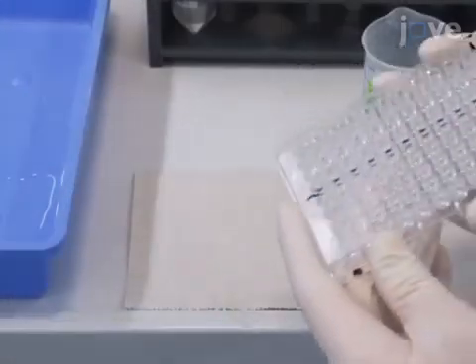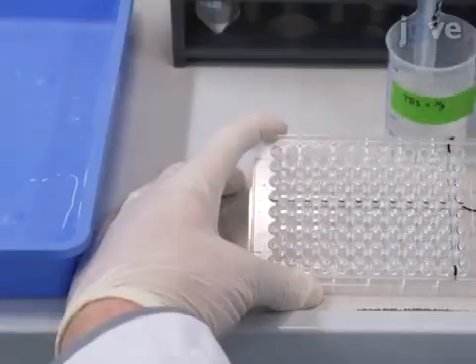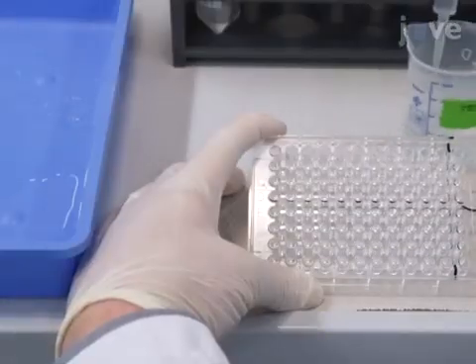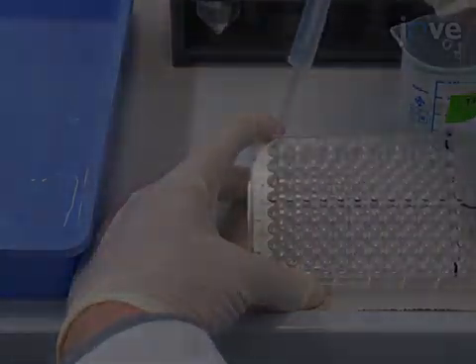The next step is to block nonspecific binding sites by adding 50 microliters of 1% BSA solution in TBS magnesium chloride.